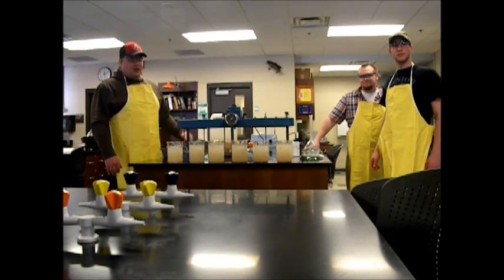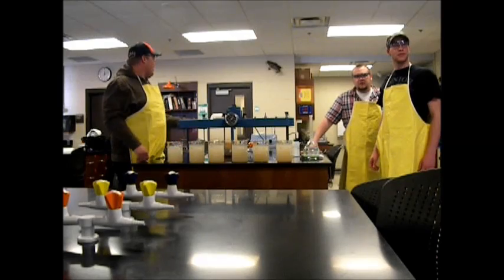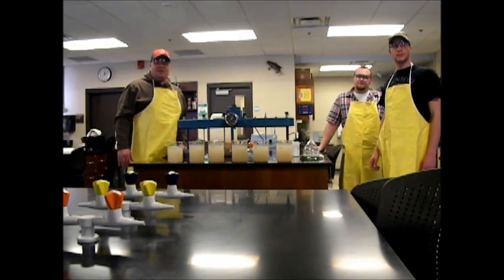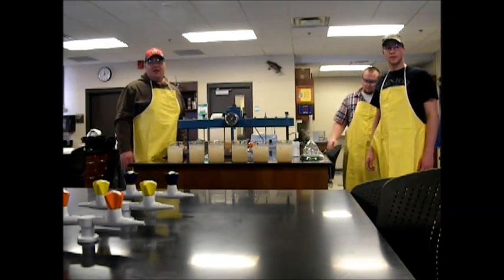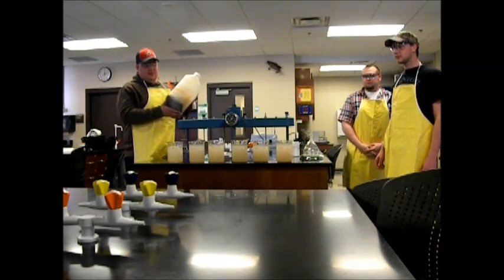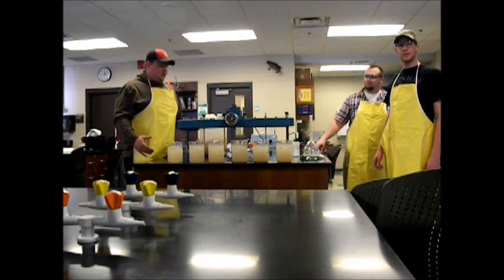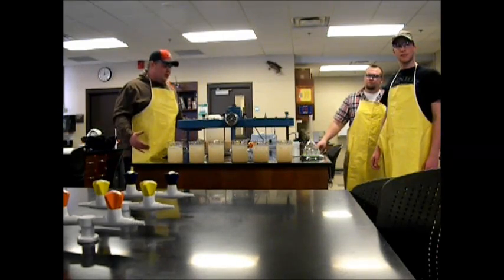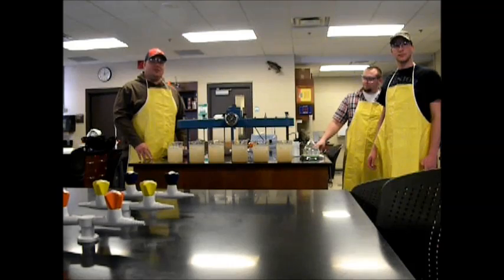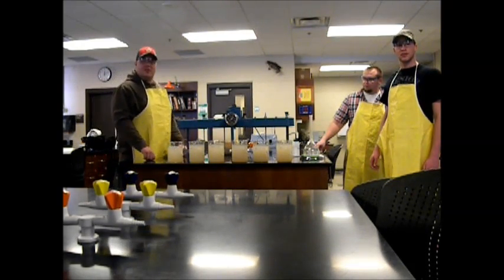For a jar test, you're going to need a six-paddle stirrer, six 1,000-milliliter beakers, an analytical balance which we have in the back of the room, coagulants — specifically a polymer — your sample which contains a known pollutant, graph paper to graph the final result, a stir plate to mix the polymer into solution, and volumetric pipettes to make sure you get the right amount of polymer into the beakers.